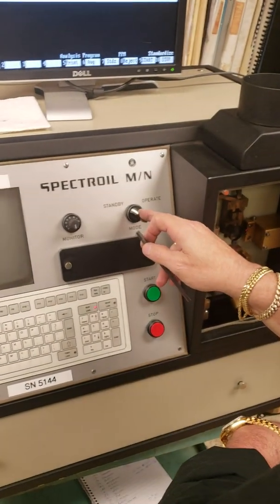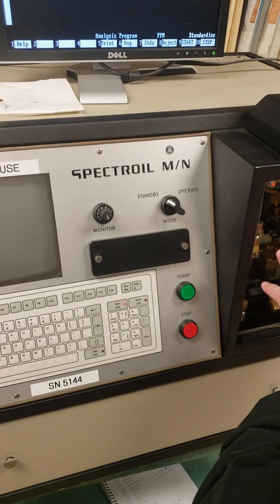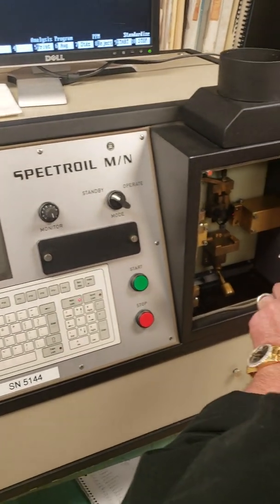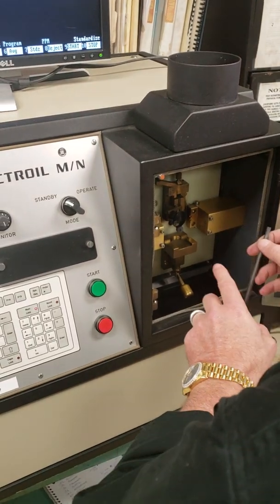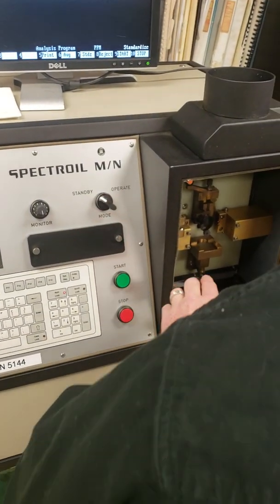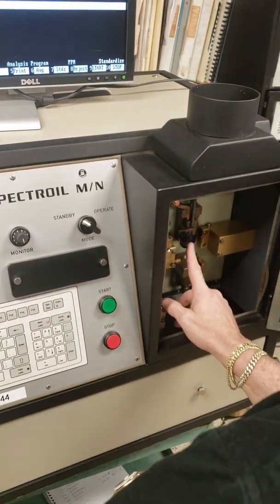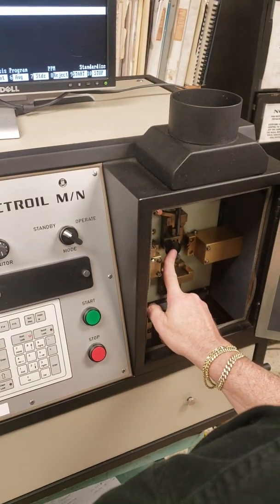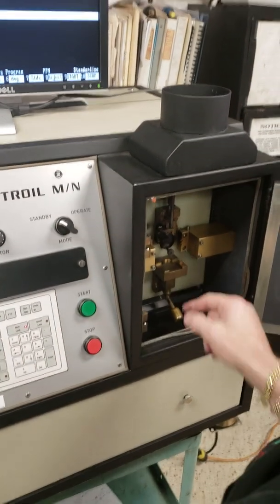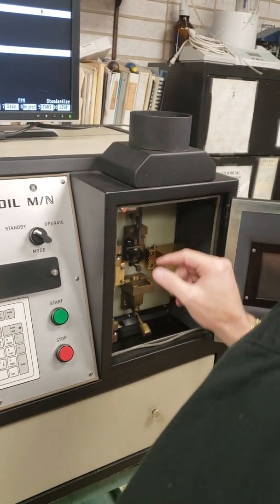Make sure this is on standby. If it's not on standby — what standby does is it shuts off the power to this box. If it's on operate and you touch the rod and the disc, it will short out and blow a fuse. So you want to make sure it's always on standby. Then you put your rod in, push it down until it touches, then push this down and that creates a gap. Now you've got your rod and your disc in and your gap set.